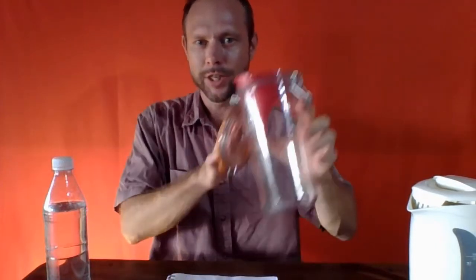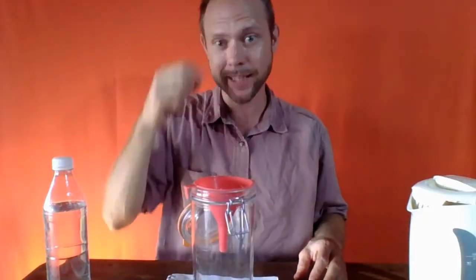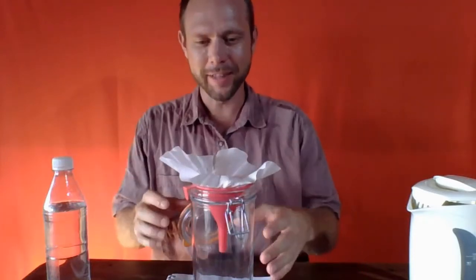It's going to dissolve the salt and go down to the bottom. We call that liquid the filtrate. And we're going to have the sand on top of the filter paper. So this is just a plain regular funnel, just a plain container. A plastic bottle would work fine. I've got a glass thing here that's maybe a little bit more heavy and sturdy that's not going to fall over on me. Now, common mistake is just to simply put the filter in the funnel. You might see that this is not very stable.